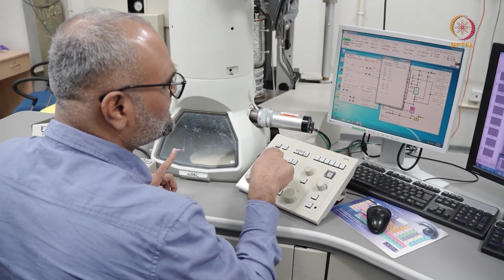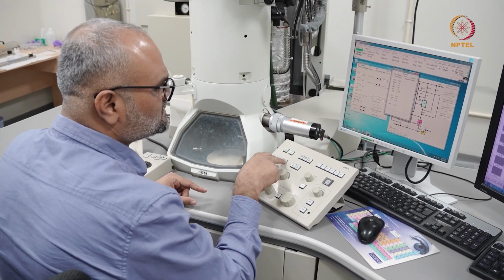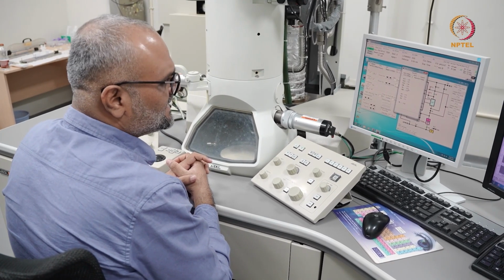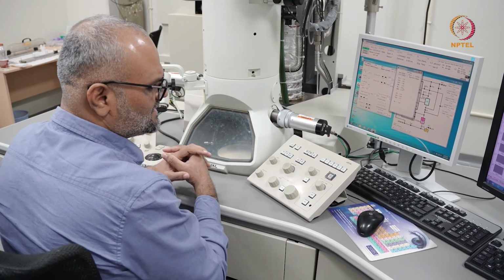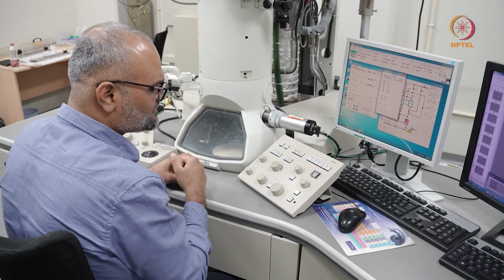For example, in SA mag, my lens is at 3.67 volt here, and when I switch to low mag, the objective lens goes off. In this condition, I can go anywhere from low mag 50x all the way to around 5000x. This is to search for a transparent area within the sample.